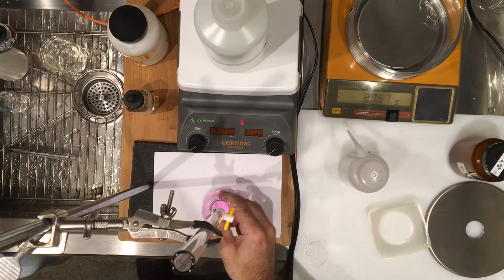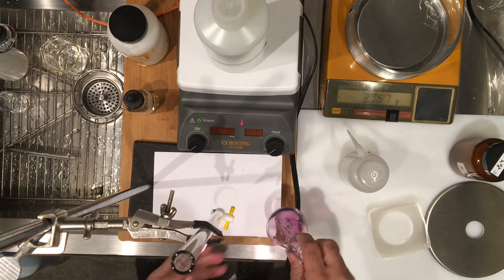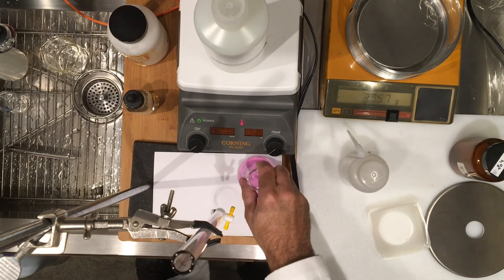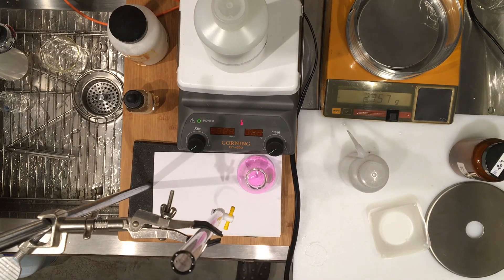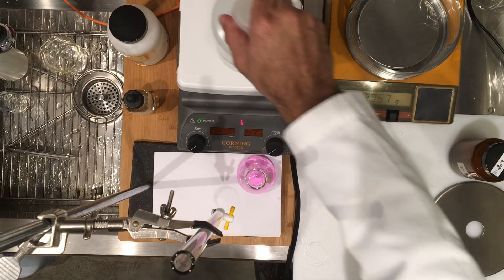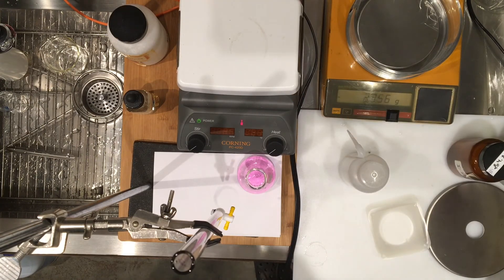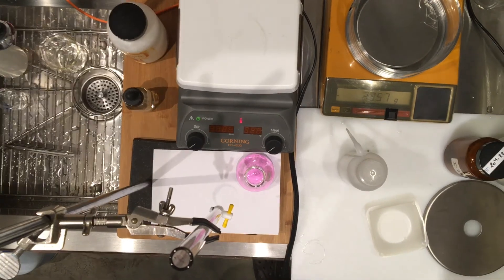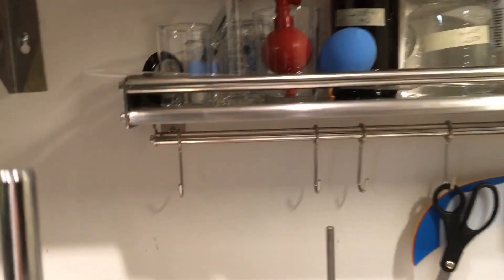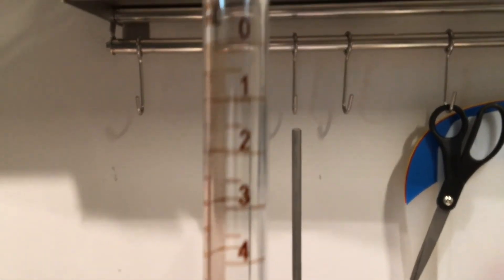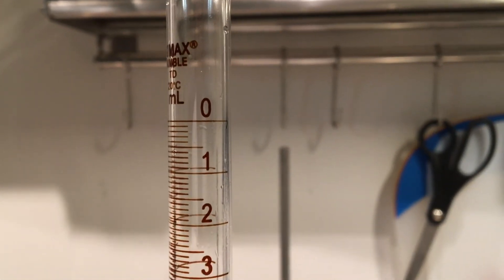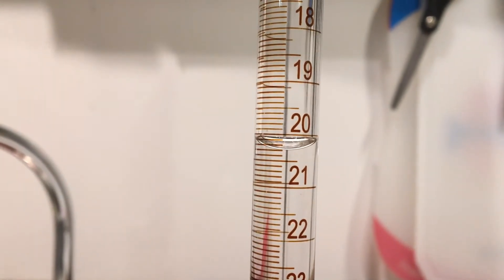So this one trial is done, and in order to have reliable data you need to do this two other times. But I want to show you, I want you to see the volume. So you can go ahead and read the volume. I had set my burette to zero milliliter, so before I started I was actually right at the zero mark, and then I dispensed this volume. I want you to read this to the precision of the burette.